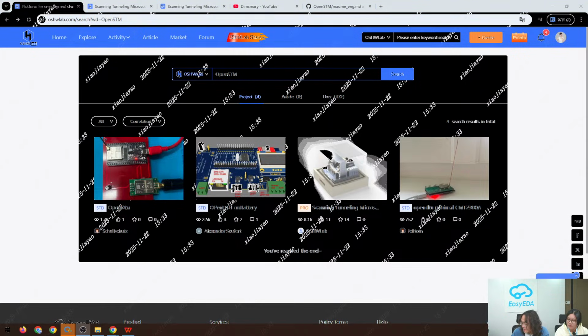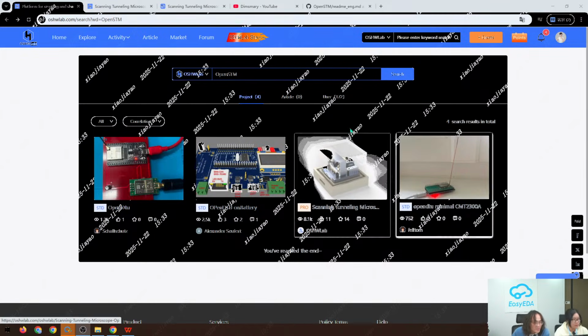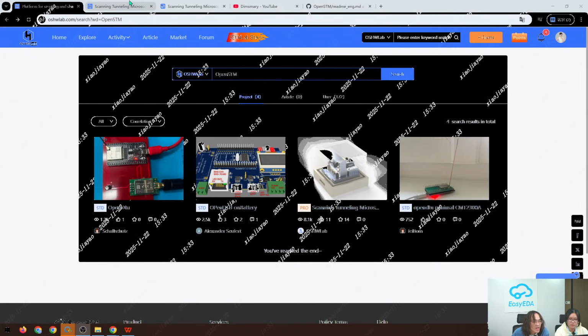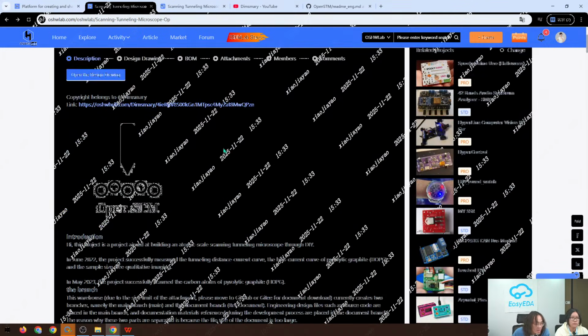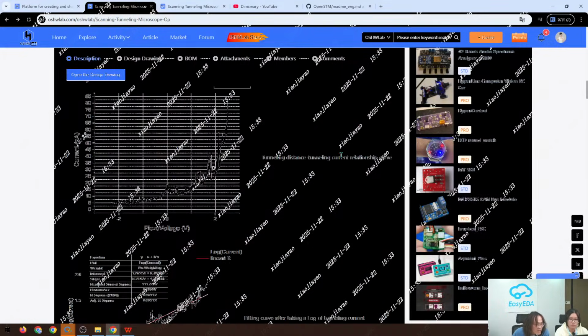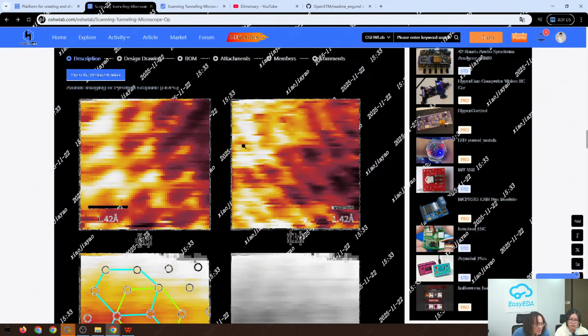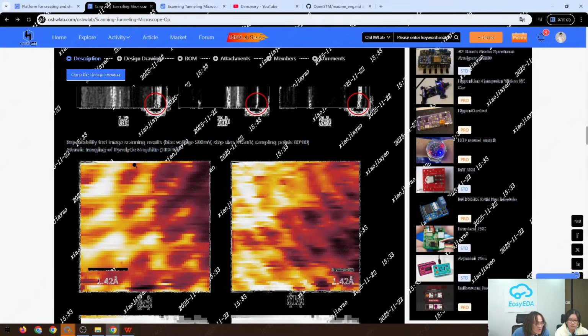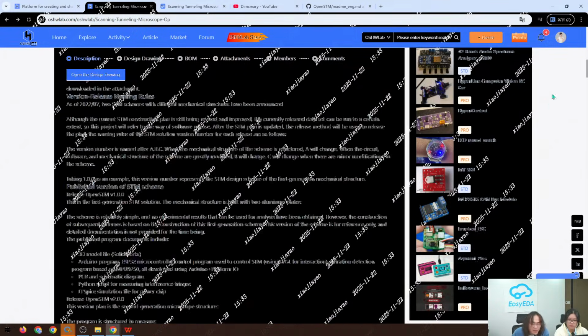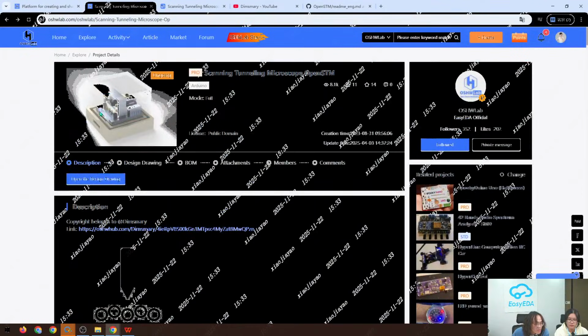Okay, the voice may encounter some issues, and now maybe it's okay. So let's continue. This is my project, and click it. You can get into the home page, and there are many introductions of my project. And here we go. This is the HOPG, or we can say the graphite image obtained by my microscope, and this is my microscopy.